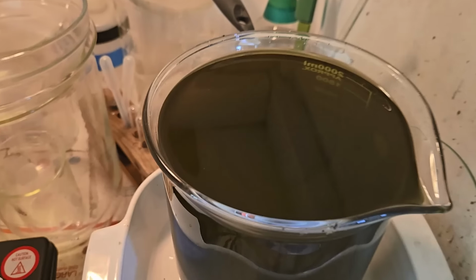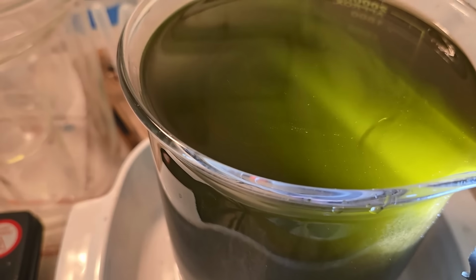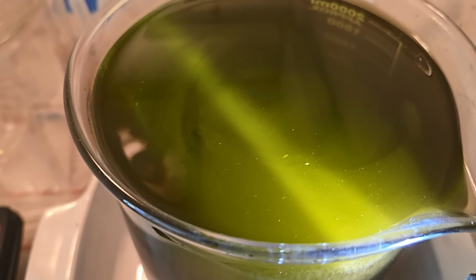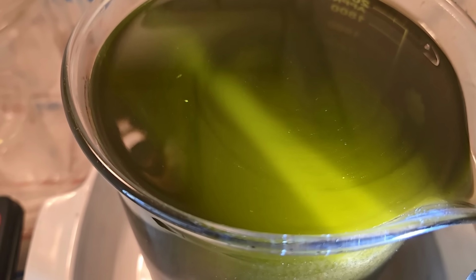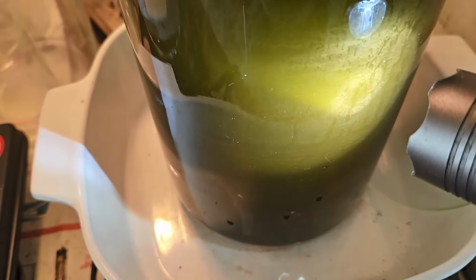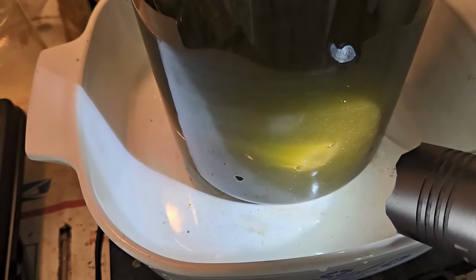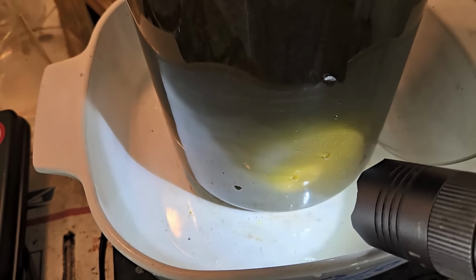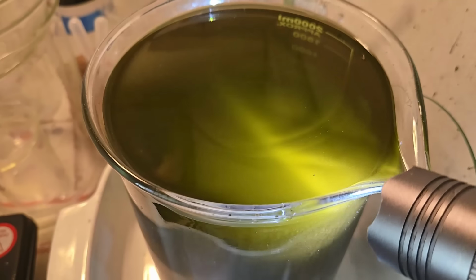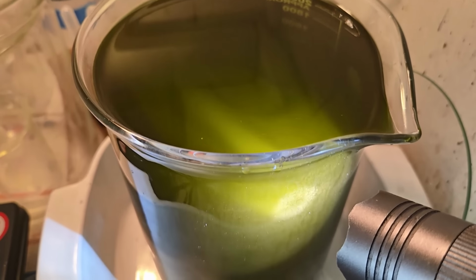All right, this is kind of cool. You can't see much looking at it from this angle, but look at this. Look at the particles of gold swirling around in there. Yeah, nice. Getting a film of gold on the inside of the beaker. I think it's starting to settle to the bottom, so that's great. So we'll just let this sit and settle.